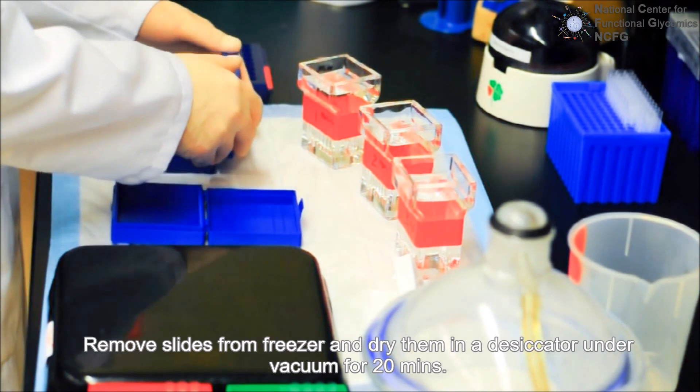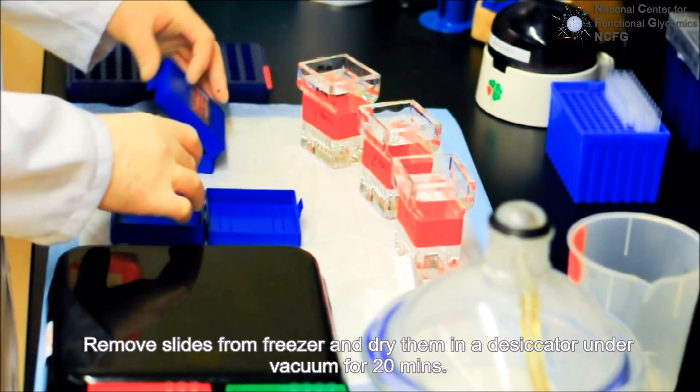Remove the frozen slide from minus 20 degrees and dry it in a desiccator under vacuum for 20 minutes.